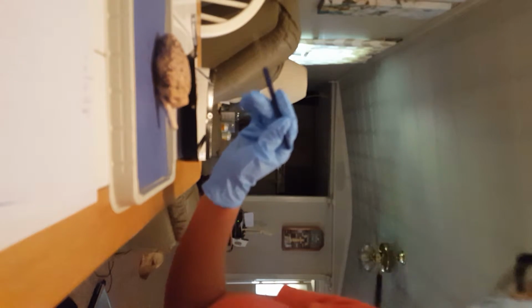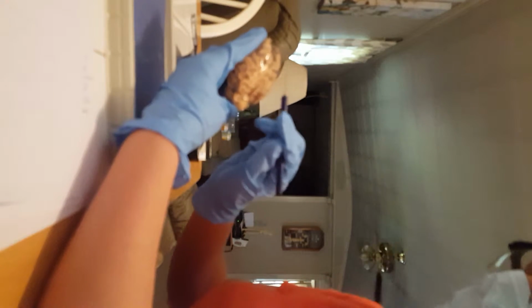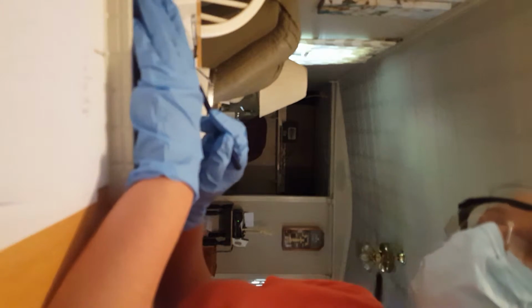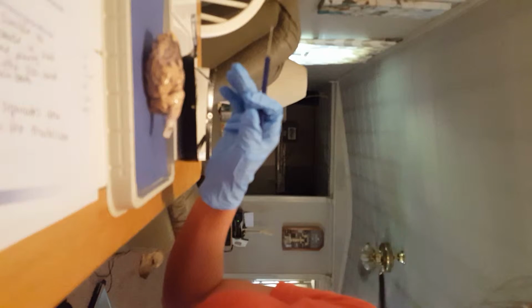Then next, we're gonna turn right here at the top. And I'm really gonna look at the pia mater, which is right about here, in between the brain. Of course, the two cerebral hemispheres are here. And I'm just gonna turn the page. I am throwing these papers away when I'm done, so I'm not gonna retouch them. I'm gonna turn the brain over and look at it from upside down, which is also known as the inferior aspect.